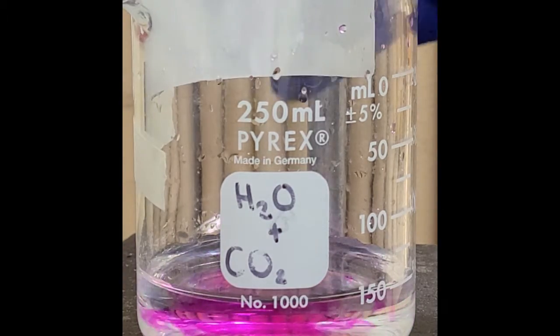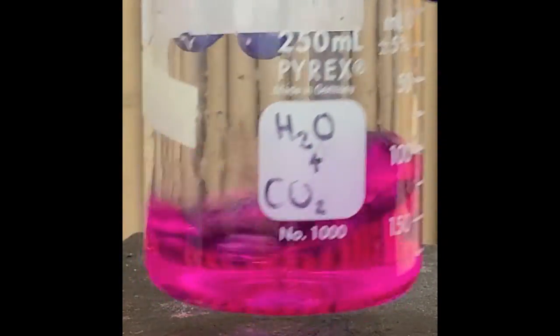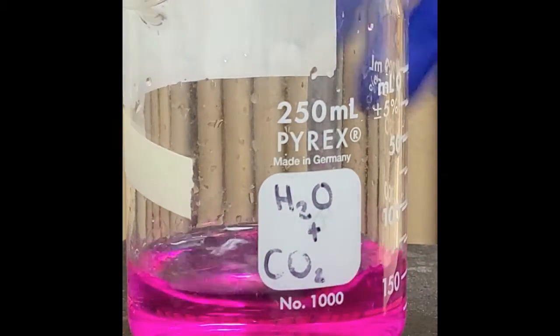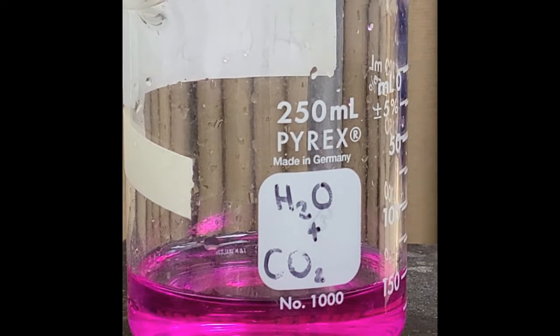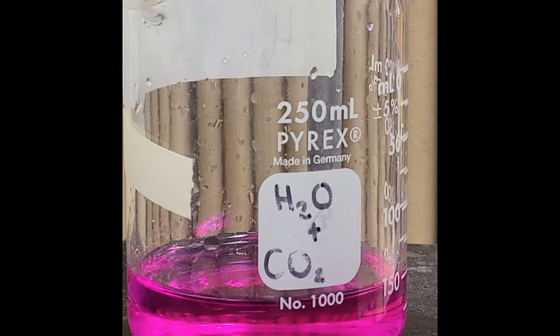Okay, we're at 22 milliliters. Oh, did we hit the pink? I think we did. Awesome. So right now we just hit a pH of 8, as a fair estimate, and that took 22 milliliters of sodium hydroxide. So let's go ahead and do some math now. You guys see that okay? Yeah, it is a pretty pink color, isn't it?